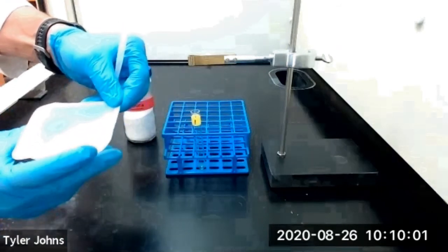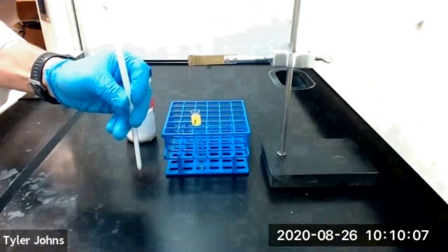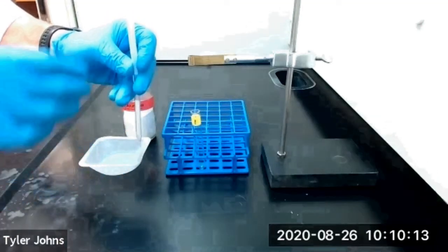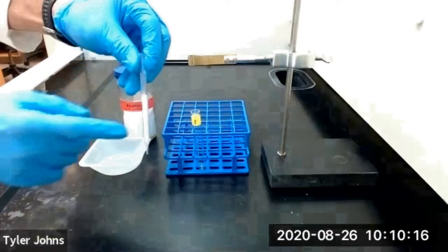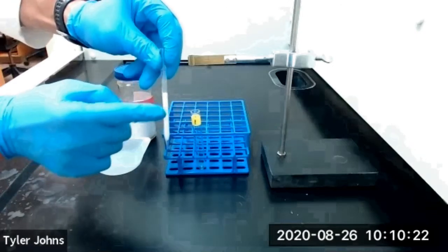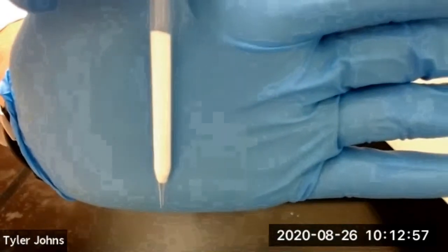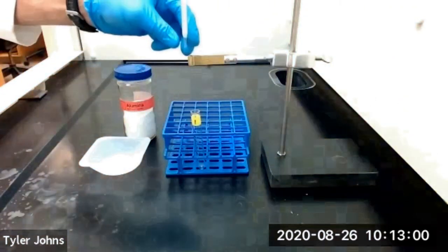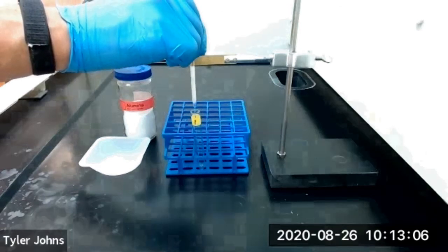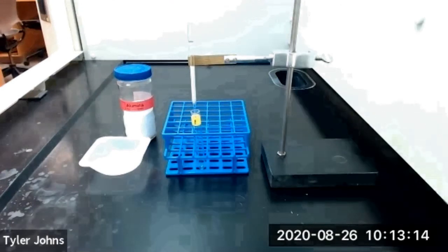We'll then transfer our 1.25 grams of alumina to our column using the micro funnel. Once we've transferred our alumina to our column, we need to gently tap our column to make sure that our alumina is tightly packed inside the column. This is our chromatography column. We need to clamp our column so that the tip of the column is just above the test tube that will be collecting our fraction. We have now completed the preparation of our chromatography column.